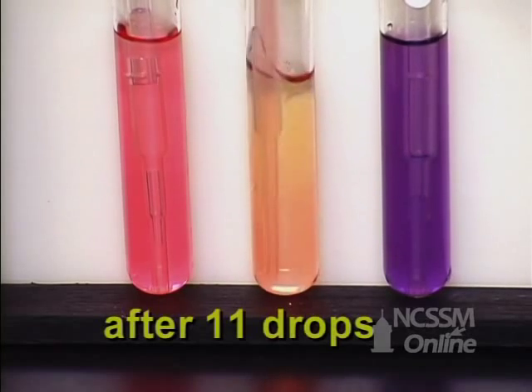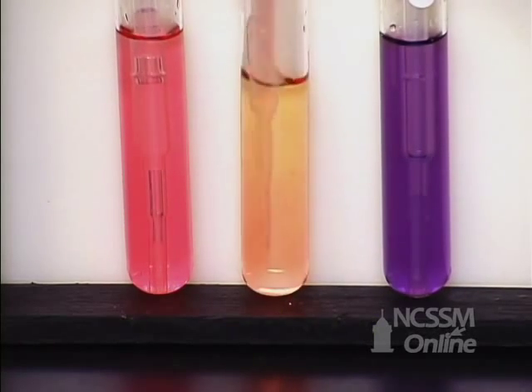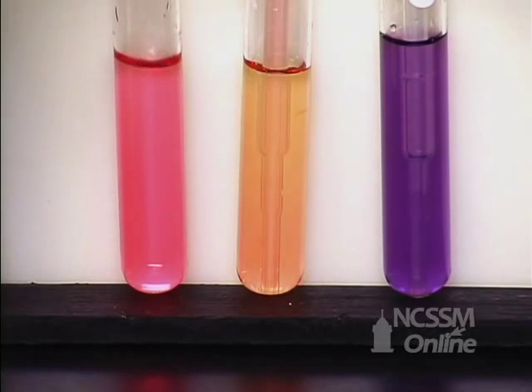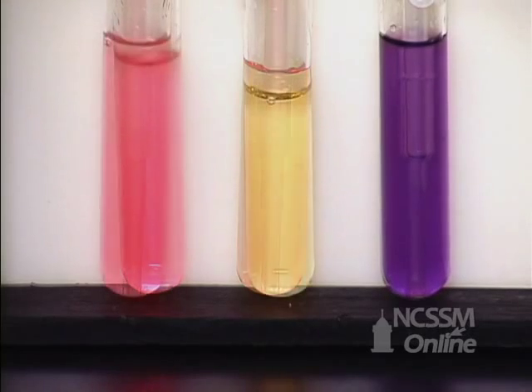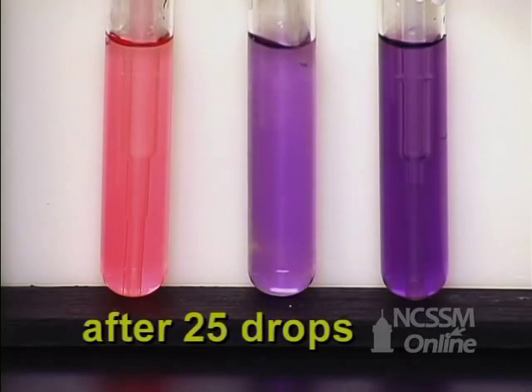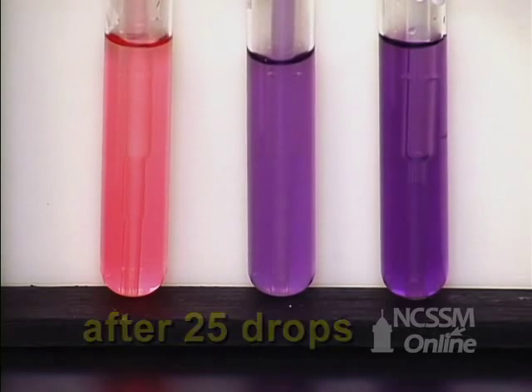Definite change in the second one. So even though these are the same buffer system, this one is more concentrated. And with only 11 drops, we've got a change. 25 drops, we've pushed it way over the edge. We've destroyed the buffer, the capacity of the second one. And the first one is still unchanged.